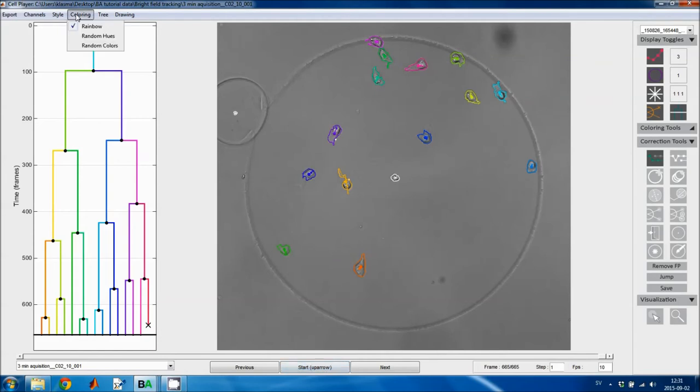And then there are 3 different coloring options. The rainbow option will color the lineage tree from red to yellow, green, blue, and back to red. If you select random hues, the cells will be given random hues, but the saturation and the value, or saturation and intensity, are both maximum. This can be useful if you're tracking sequences with many cells, because then the daughter cells in a cell division will usually have different colors, and that can make it easier to link the tracks.